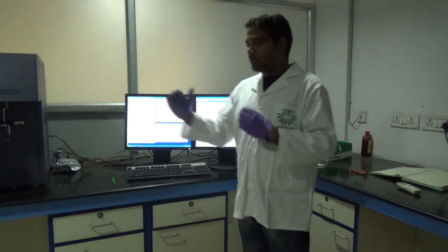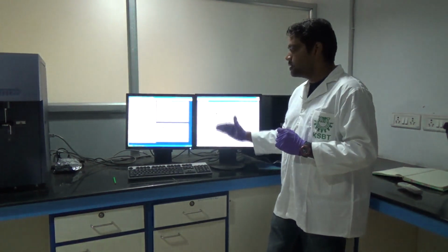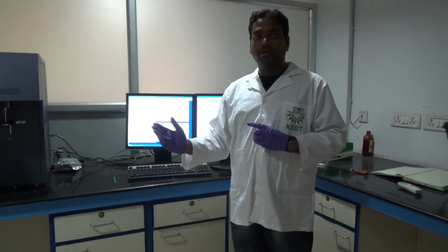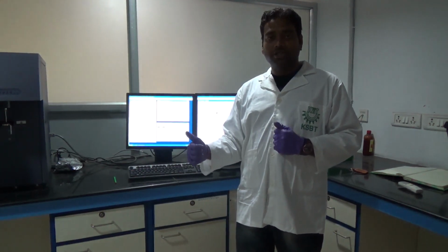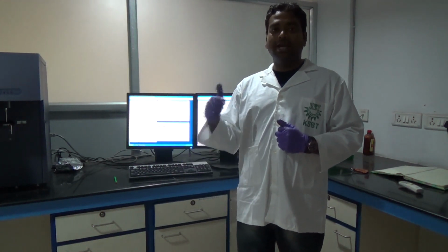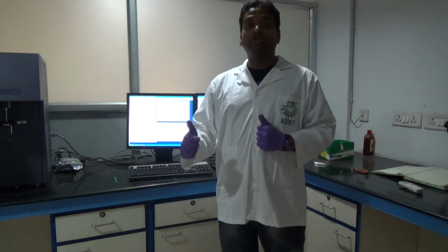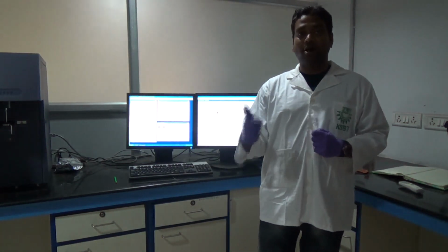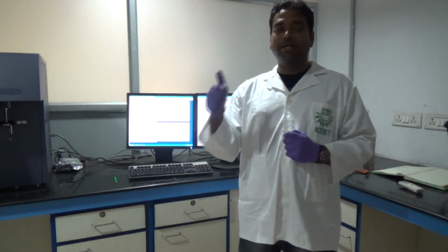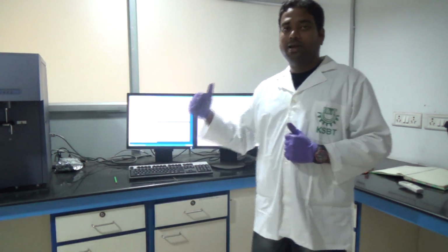So this is the basic principle of how this flow cytometer works, and how we make this gate. This is with a single analysis. Many things you can do. You can check reactive oxygen species formation. You can check pore formation. You can check the expression of different proteins, cytoplasmic proteins. You can also check the expression of surface markers. We can stain those proteins with our specific marker and analyze.